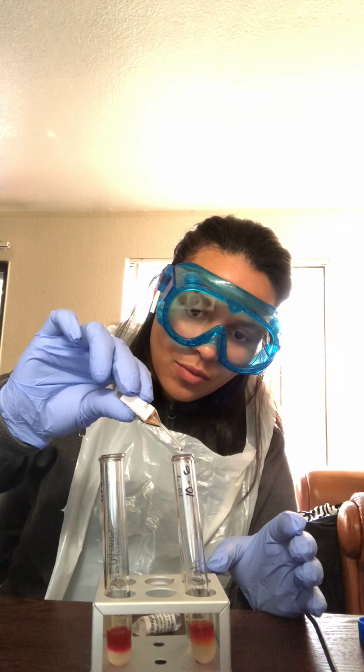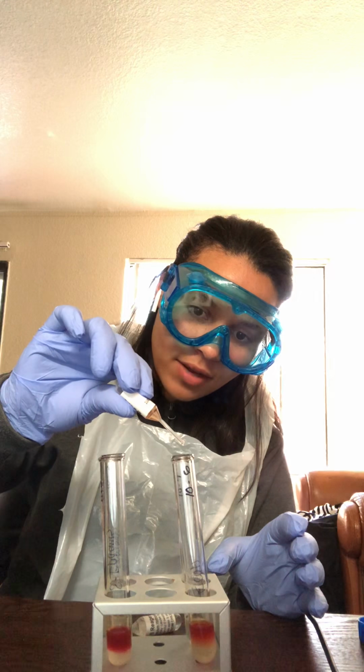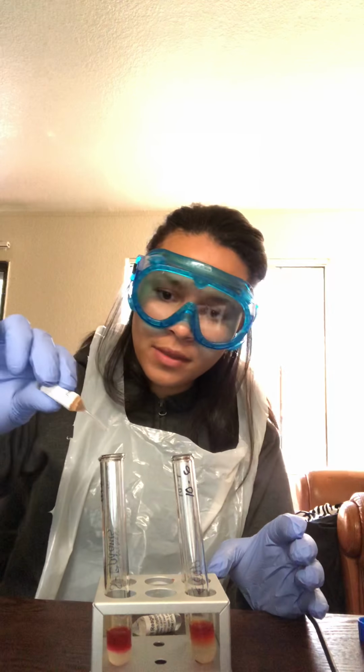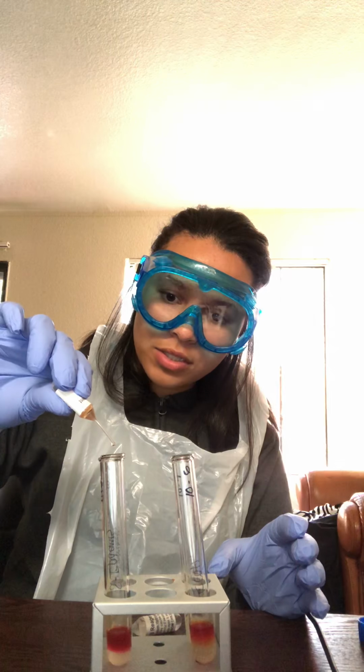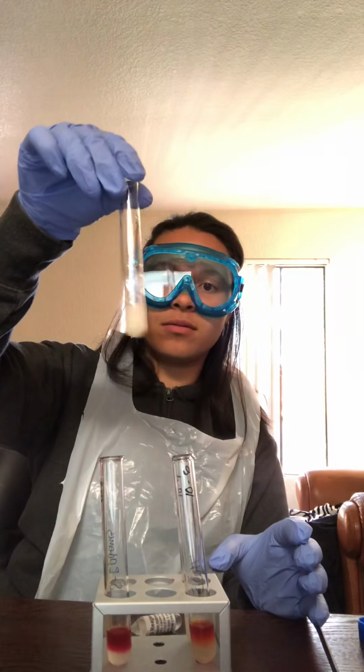So we'll go ahead and start and check the results. 1, 2, 3, 4, 5, 6, 7, 8, 9, 10, 11, 12. And again, 12 drops. And I'll give it a little swirl.